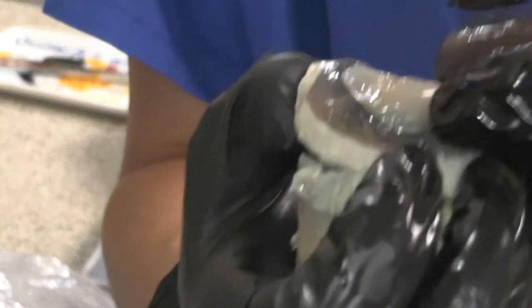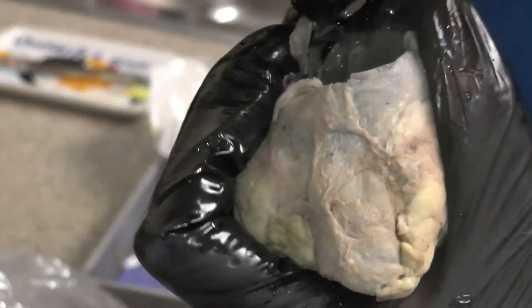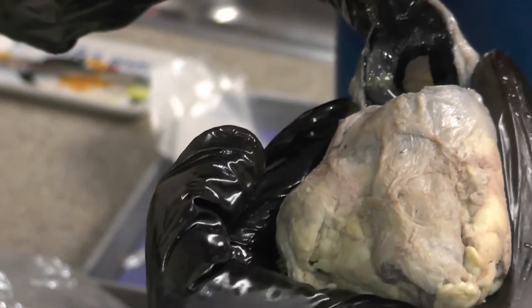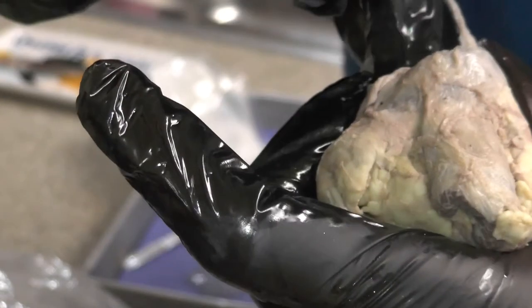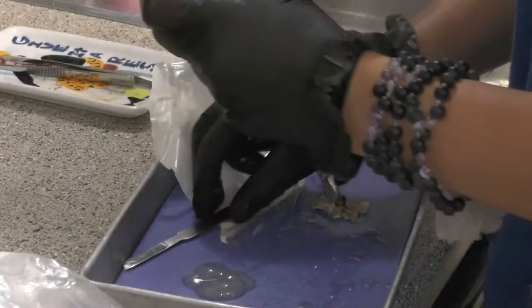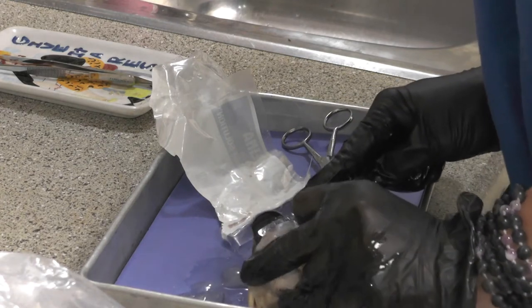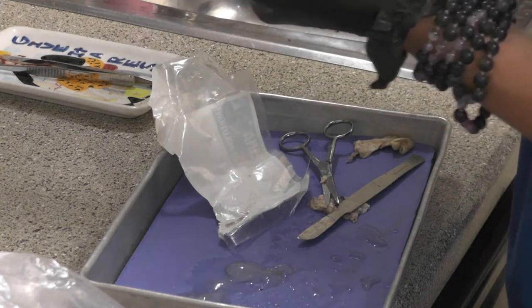The iris is actually back here — you can't see it. I'm going to remove this tissue. If you look back here on the posterior aspect, that hole is the pupil. In front of that, the tissue I'm touching on the interior is the cornea. Right here is the ciliary body and the ciliary zonules — you can see they're textured — and right in front of that is the iris. Let me finish making this cut. That's actually pretty awesome.